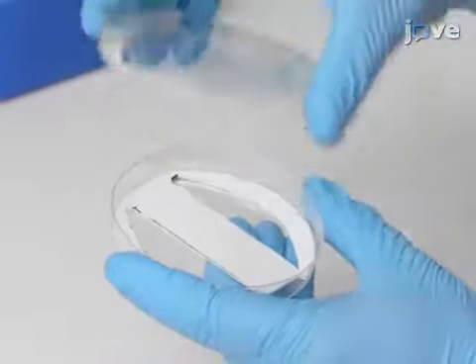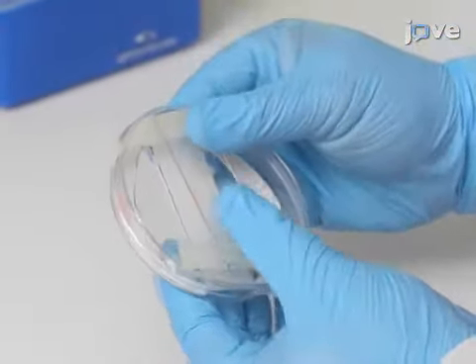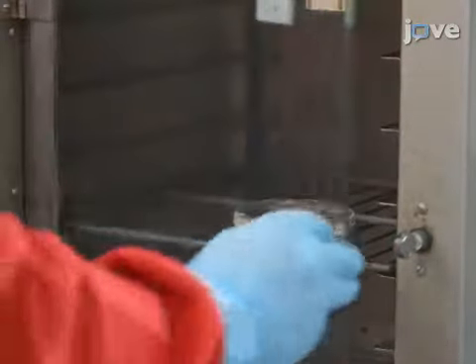Place the top half of the vapor chamber on the bottom half, ensuring the paper finger and sample slide align perfectly, and seal the chamber around its equator with paraffin film. Leave the sample overnight in a 37 degrees Celsius incubator to allow complete digestion.